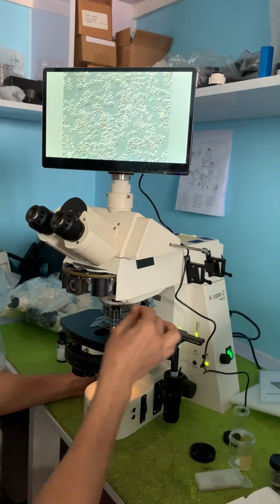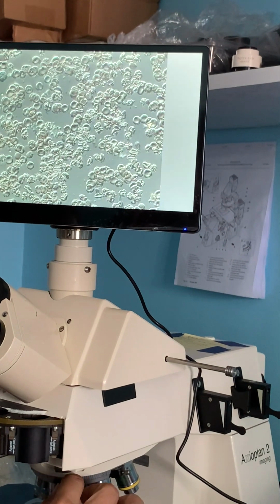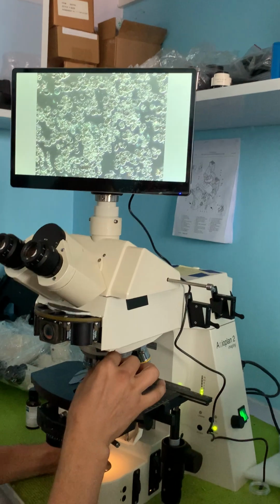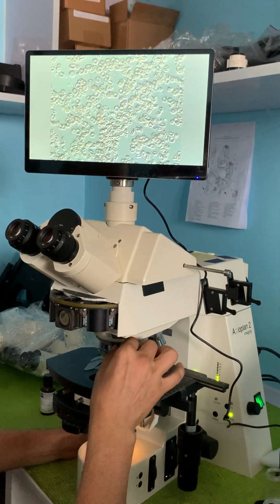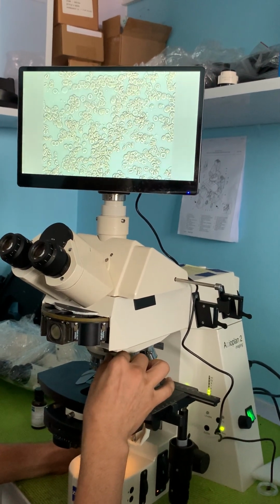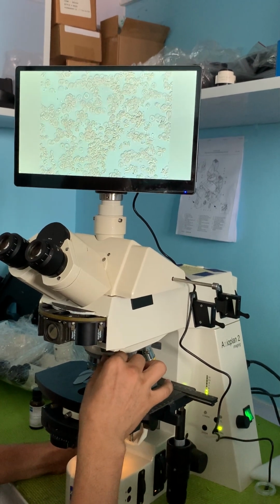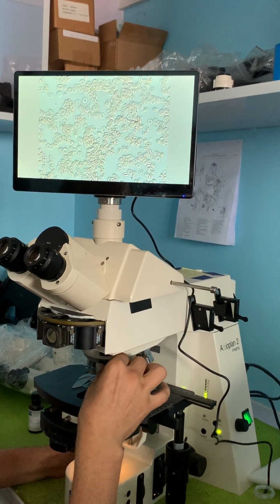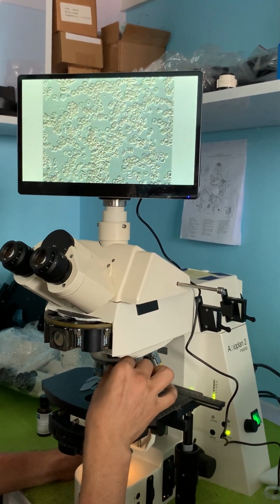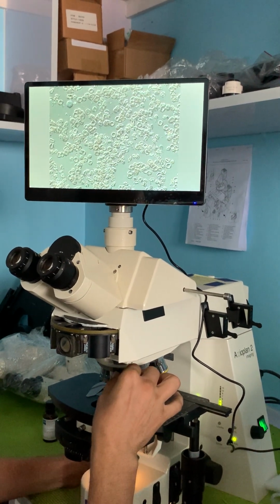Now I'm going to change the shear plane on the DIC prism. I rotate this knob. If you notice, we're going through like a pseudo dark field at this point, and we keep rotating it to the other side of it. This just affects our contrast and how we look at it. And I'm going to turn it the other way. I'm going to go past that pseudo dark field, which is right in here. It's a pseudo dark field. Now I'm on the other side of it.